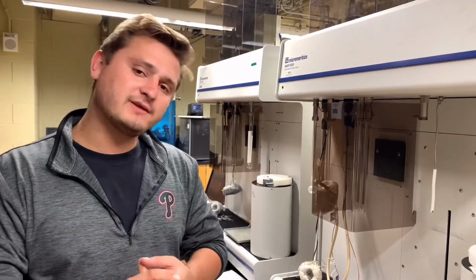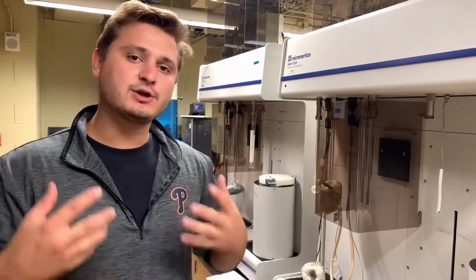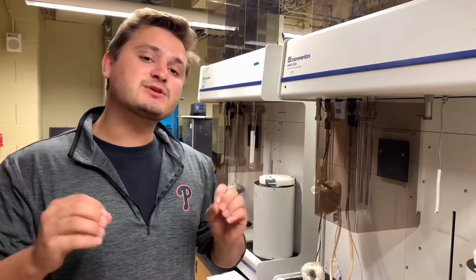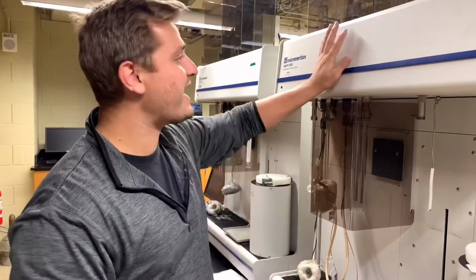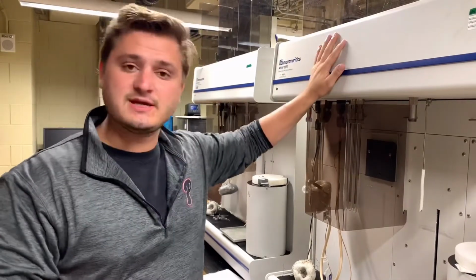If the last solvent that you have is another organic solvent, such as acetone, hexane, chloroform, dichloromethane, things of that nature, you absolutely must dry your sample for 48 hours beforehand. We do not want any of that solvent to get up into the instrument and create leaks. The seals in the instrument are either plastic or rubber, which can be corroded or damaged with organic solvents of that nature.